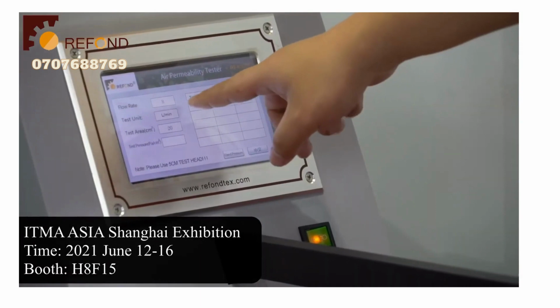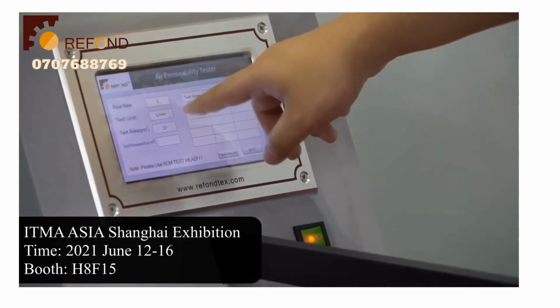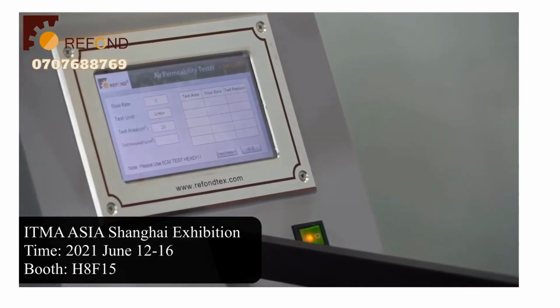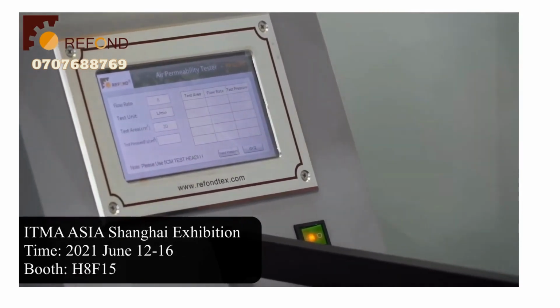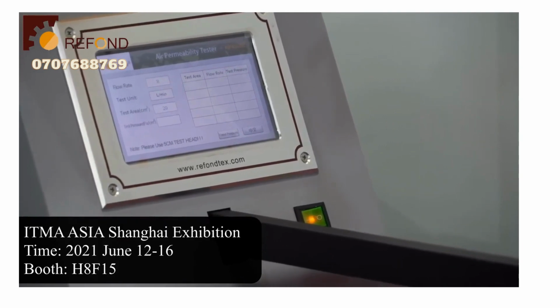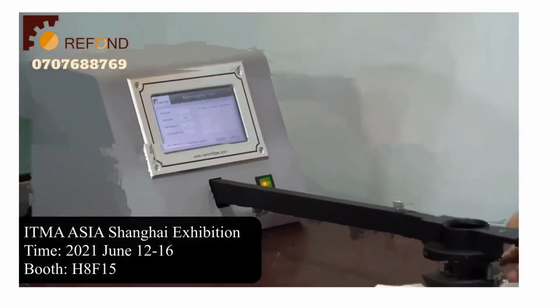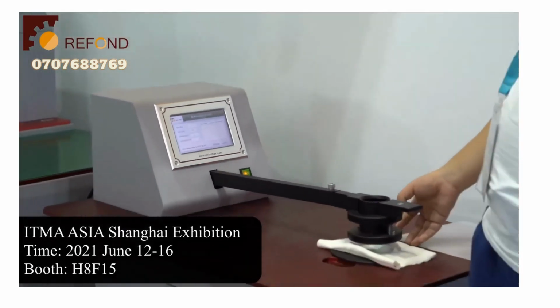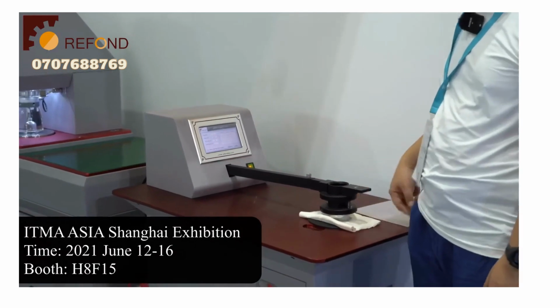For this fixed flow rate test, the standard requires an 8 liters per minute flow rate. And when doing the test, the machine will control the flow rate flowing through the face mask to be 8 liters per minute. And then the pressure across the mask is the main measurement required by the test, and it will be used as the result.